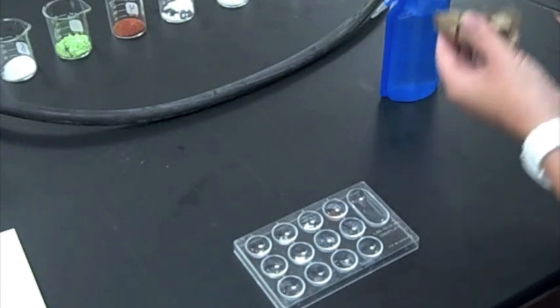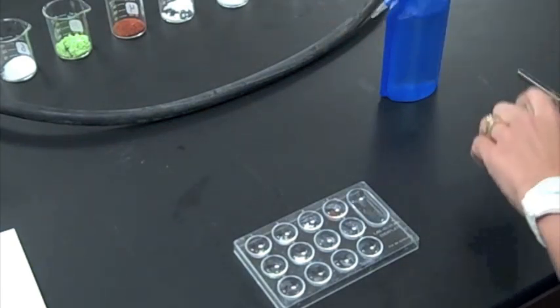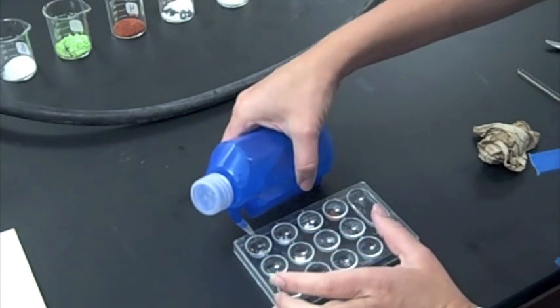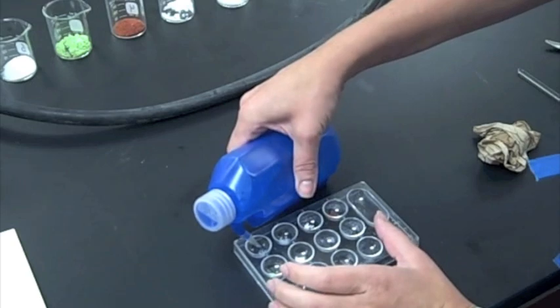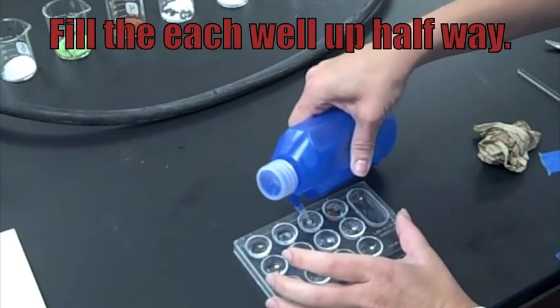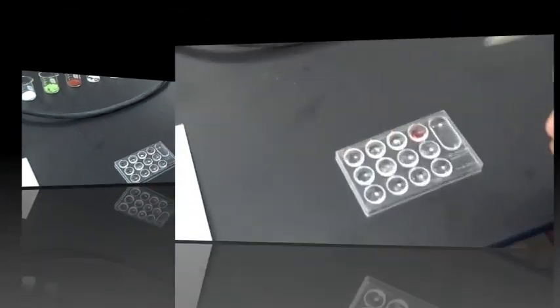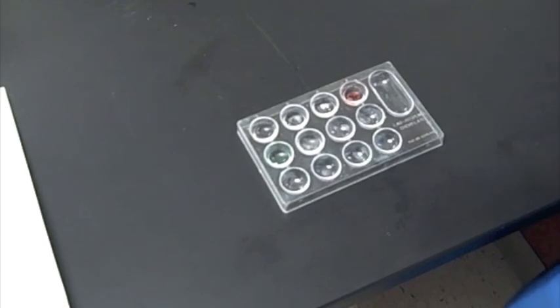But it definitely does not dissolve the same way that salt dissolves. Alright, so there's all of our compounds in there. Now we're just going to add a little bit of water. Actually, quite a bit of water. Go ahead. I know it says 10 drops in the procedure, fill it up about halfway. Okay, so I'm going to take my glass stirrer and clean it off in between each stirring. I'm going to stir each of these.